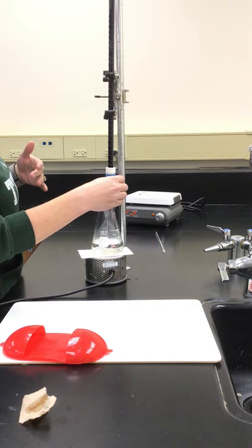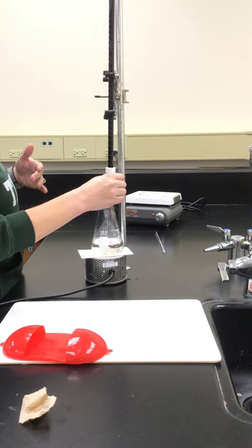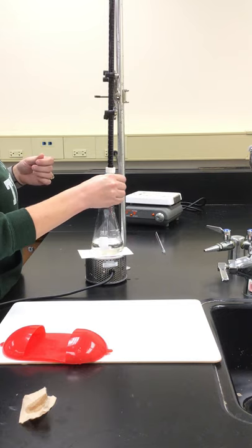I have a rough idea of how much it's going to take for us to turn that light pink, so I'm going to go a little fast in the beginning here just to speed things up, and then we'll start to slow down in a minute.